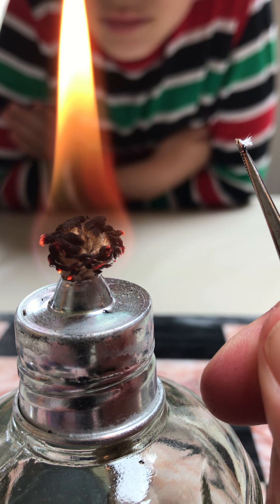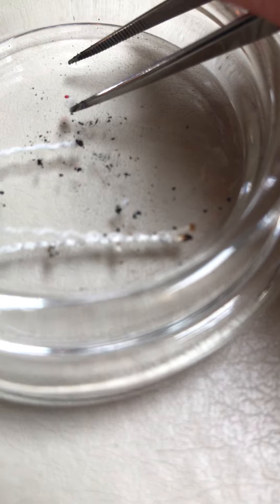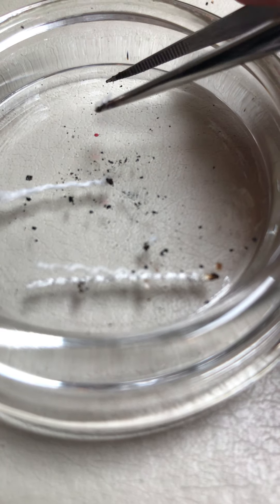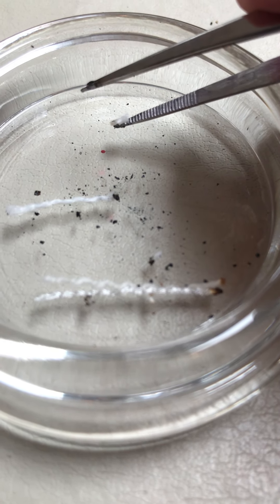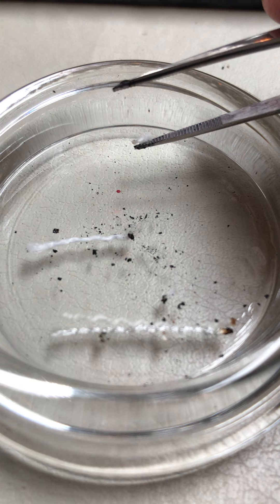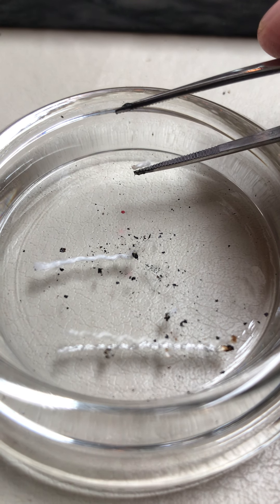Obviously if we plunge the cotton fiber into the flame it's going to ignite and burn along the length. Now let's look at our residue - putting this into our watch glass. If you look closely, there's really no residue left on the fiber, no ash, nothing - it just burns up completely. We're going to do this for the rest of the fibers, but you have a good idea of the procedure we would be following had we actually been in lab.